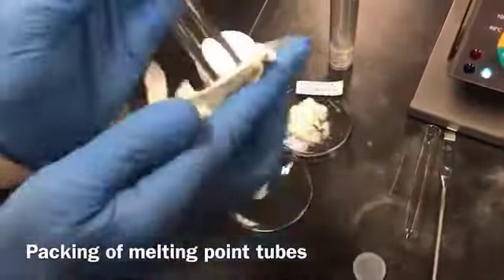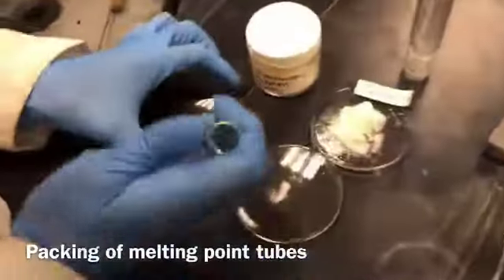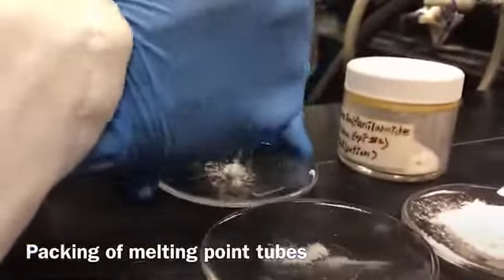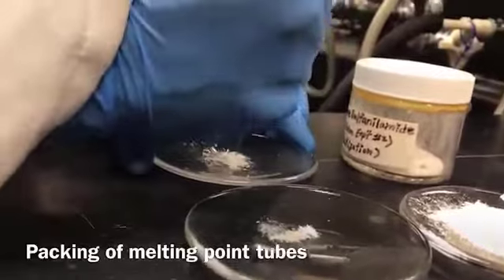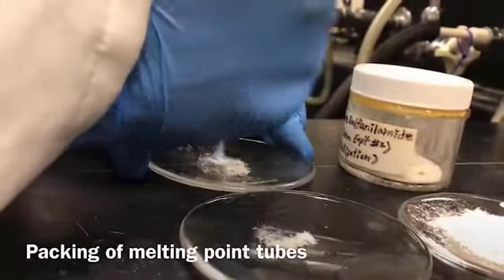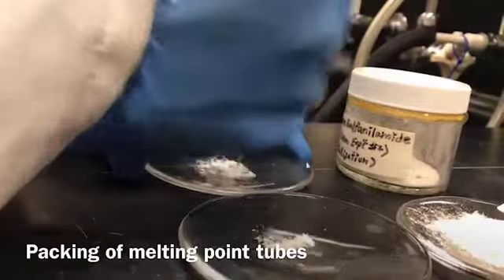So I'm going to clean the bottom of the test tube, and let's see the impure one. I'm going to crush it to a powder to make the sample even. As I mentioned, you can use the spatula as well, but I find this one is much more effective and easier to use.